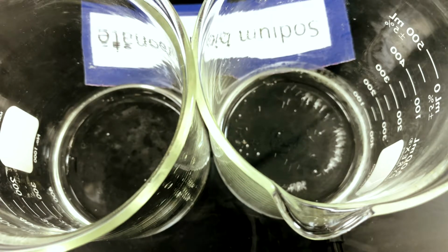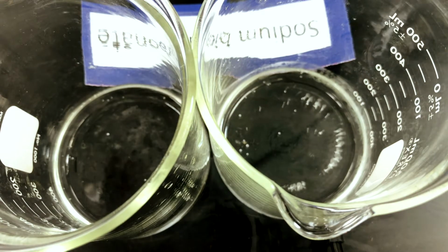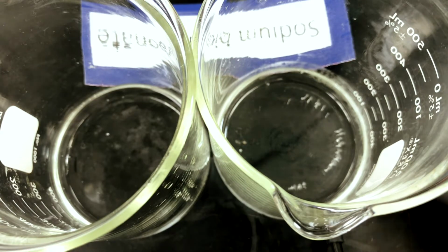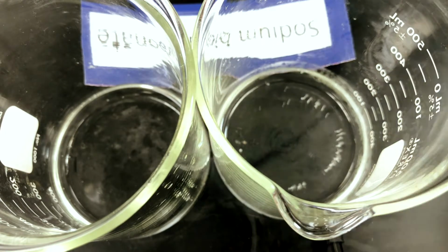At now 2 minutes and 55 seconds, I do not see any more bubbles forming. There's a couple of bubbles stuck to the bottom and a couple on the surface that haven't popped. So now this one continues to run. There are still bubbles being produced in the cold side. So our initial guess, if this plays out like it seems like it's going to, is that the cold reactant caused the reaction to take longer to finish.